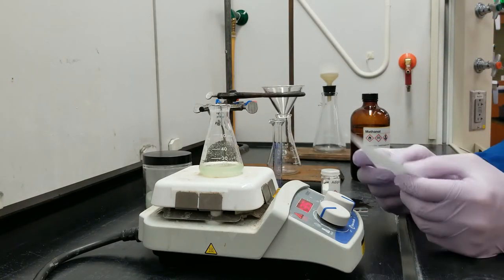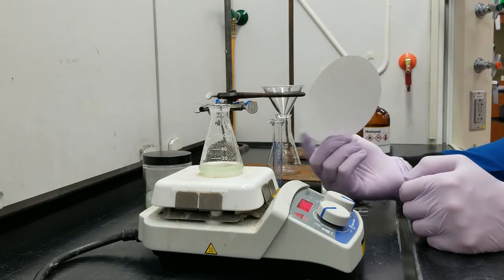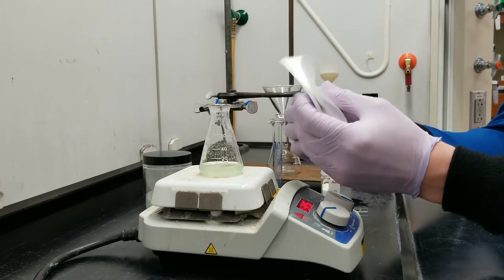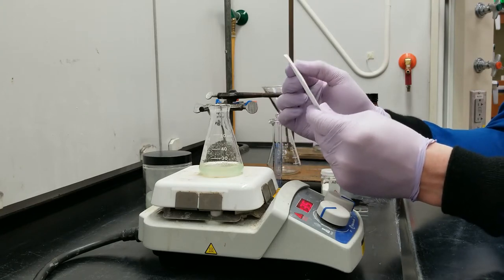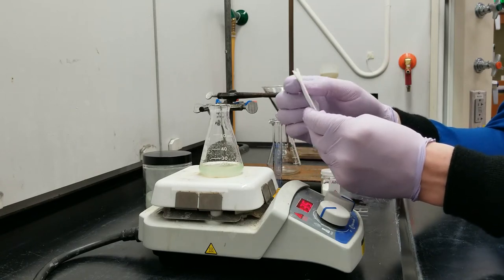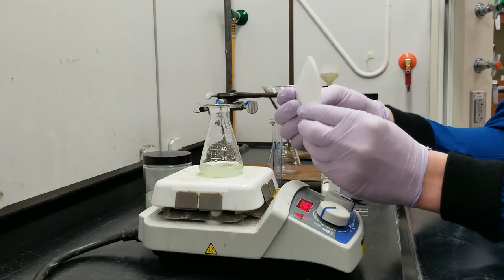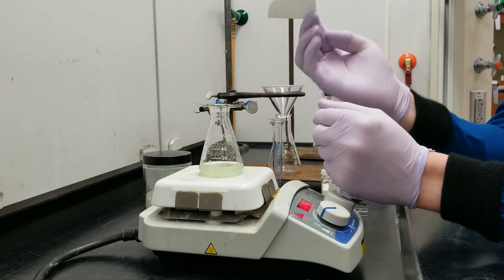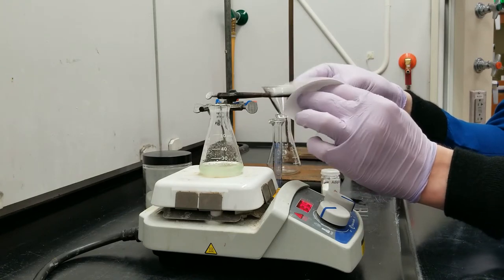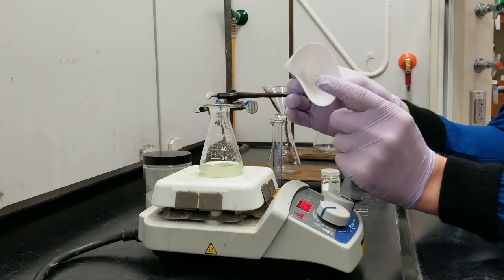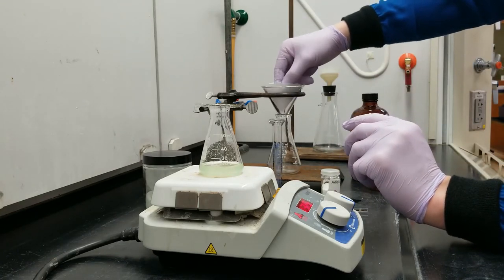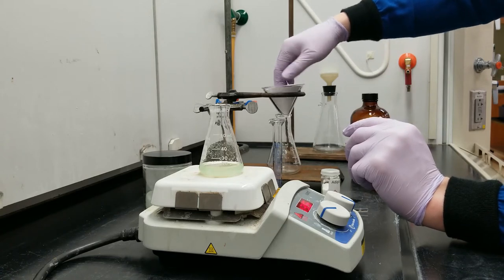While that's heating up I'm going to fold a filter paper and those of you who make coffee are going to be very familiar with this procedure. I'm just going to do a little quad fold here. By folding it into a quarter like this and just pulling away one of the lips I get a nice closed funnel that I can use a little bit later.